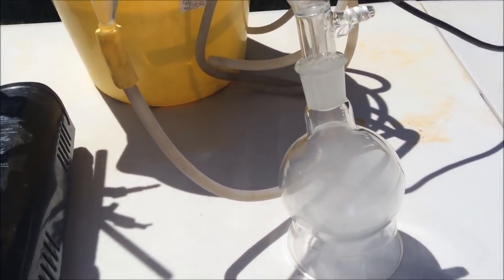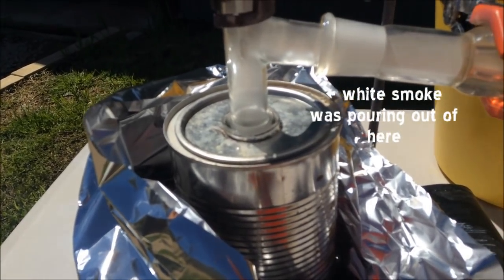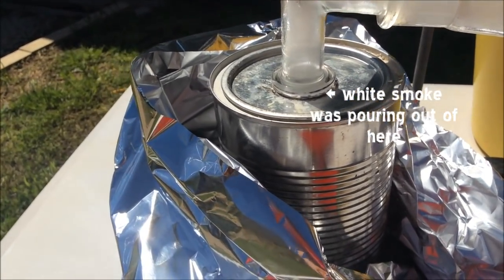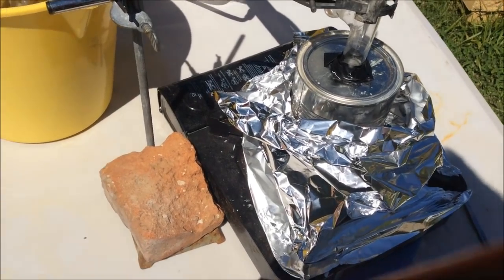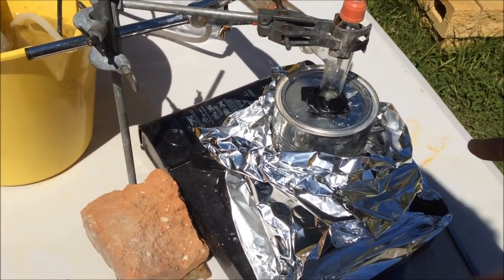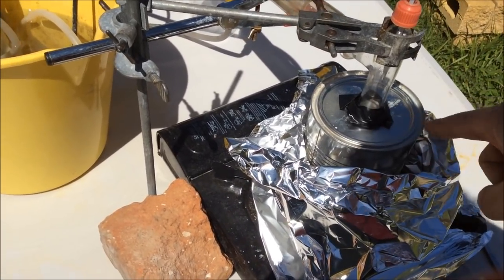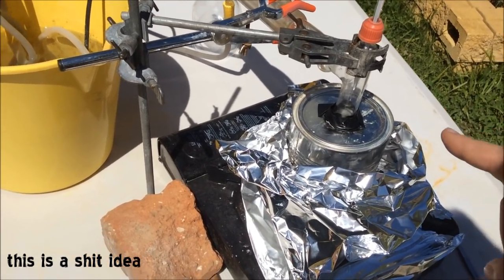It smells terrible. But it's also leaking out that joint, so I'll just stop this for the moment. So I got sick of using this bloody PTFE tape, and I think I've run out anyway, so it's probably the worst idea I've ever had, but I used to use some electrical tape. It'll probably melt, but if it melts, it's not a big deal, right?